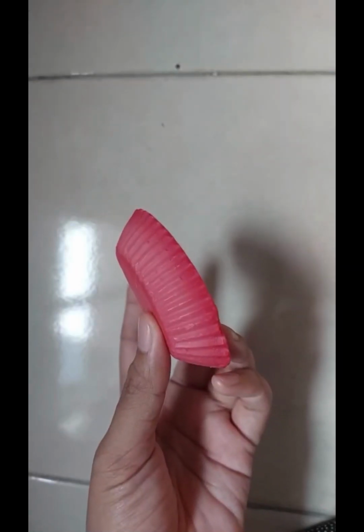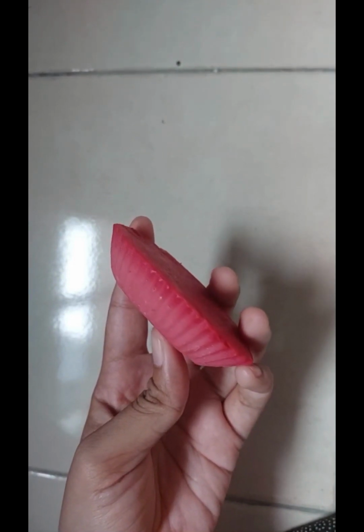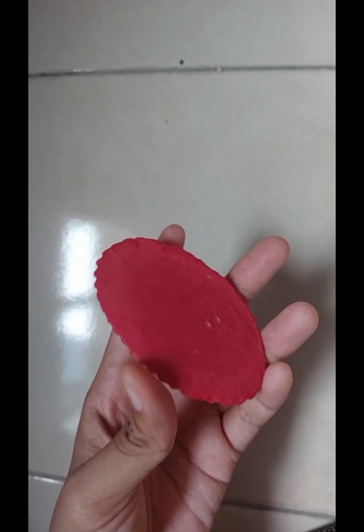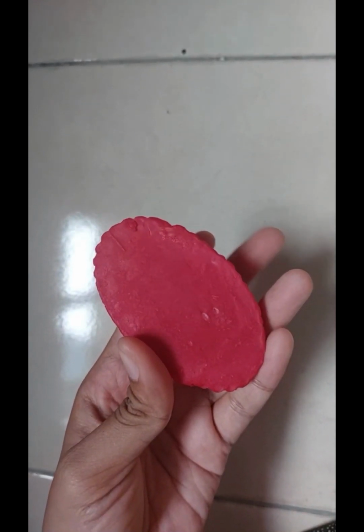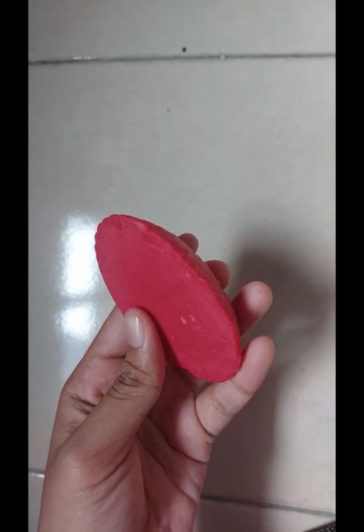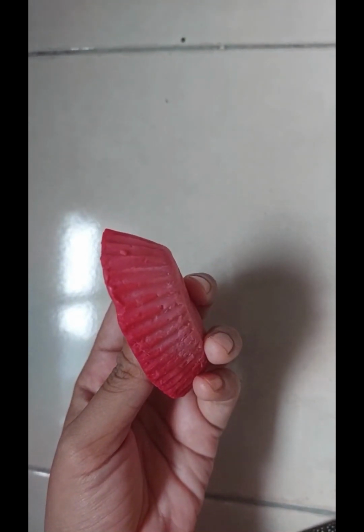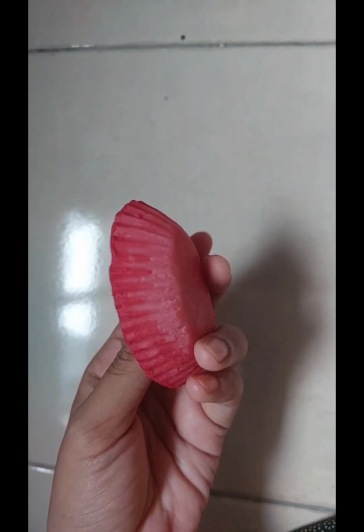In conclusion, soap production from used cooking oil is an environmentally responsible and cost-effective approach to waste reduction and sustainable product development. The objective of the experiment has been achieved in producing soap using this used cooking oil to evaluate the quality and cleaning ability. In addition, the production of soap can evaluate the feasibility of converting used cooking oil into environmentally friendly soap. Recycling used oil into soap can reduce the environmental impact of disposal.